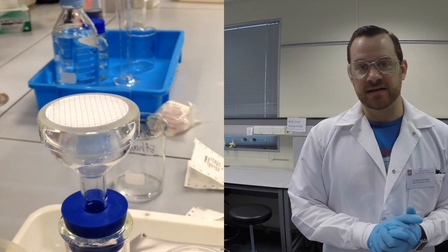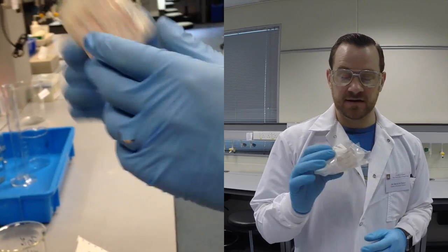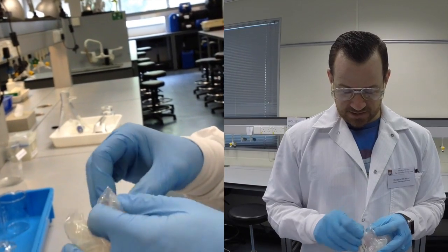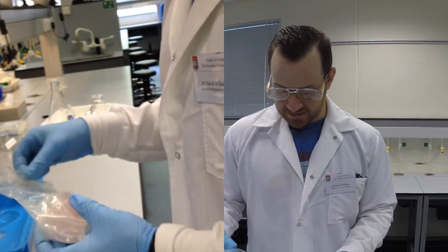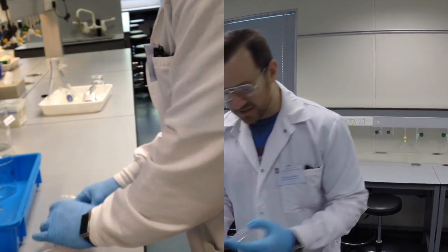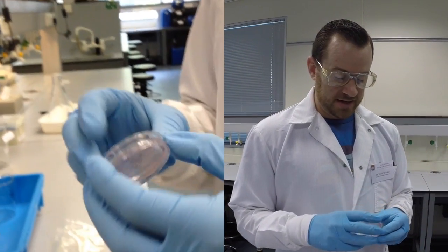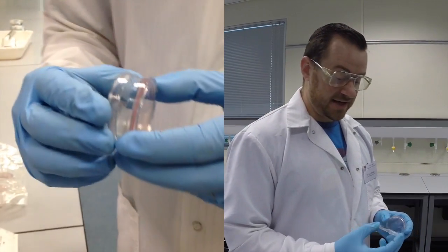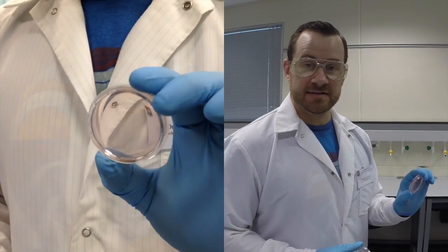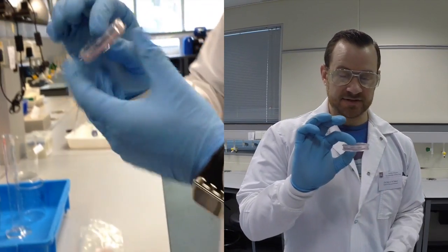And before I handle my membrane, I'm going to get my media plate ready. So we have these pink-colored Enterococcus specific media plates that are available for you to use. I'll open up the container and get one of the plates out. These small plates are the perfect size for the membrane filter, so the filter will fit perfectly in here. And you'll notice that there's two sides. There's a top and a bottom. The top has nothing in it, and the bottom has a thin layer of the pink Enterococcus agar. So the lid goes on just like that.